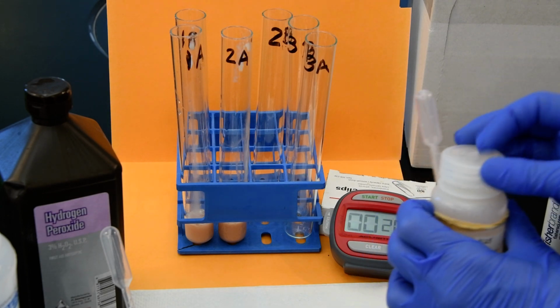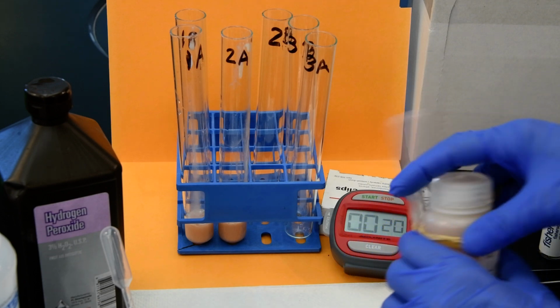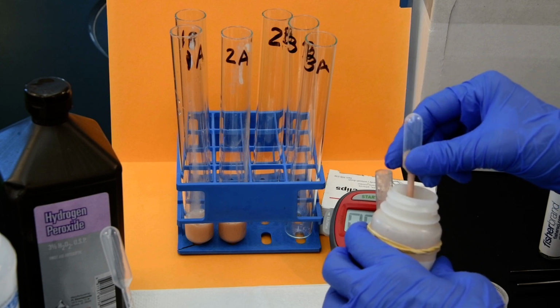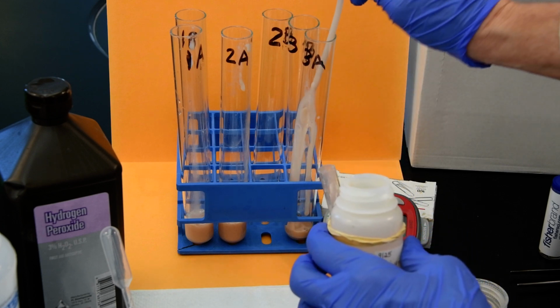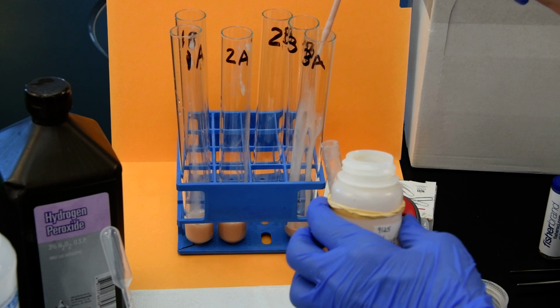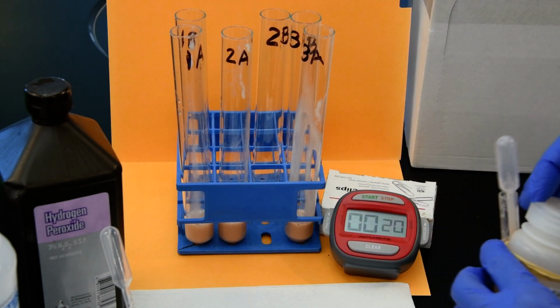And let me just kind of shake it up a little bit again. Make sure it's nice and mixed up, because we've got enough room for error here. We don't want 2 going down. And 3. Okay. Make sure all that came out.